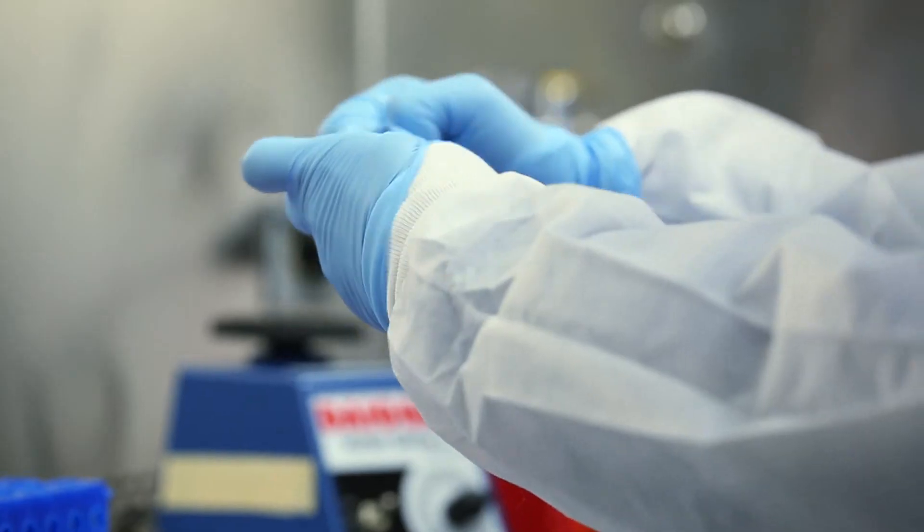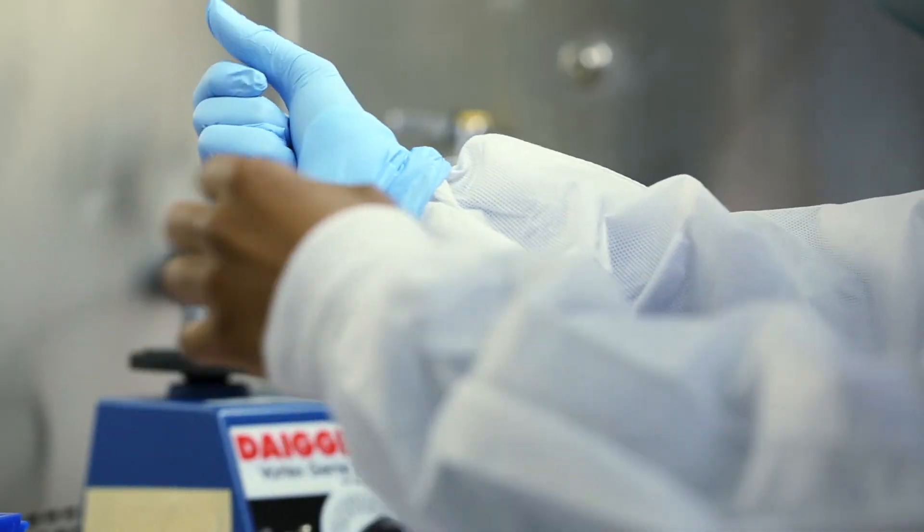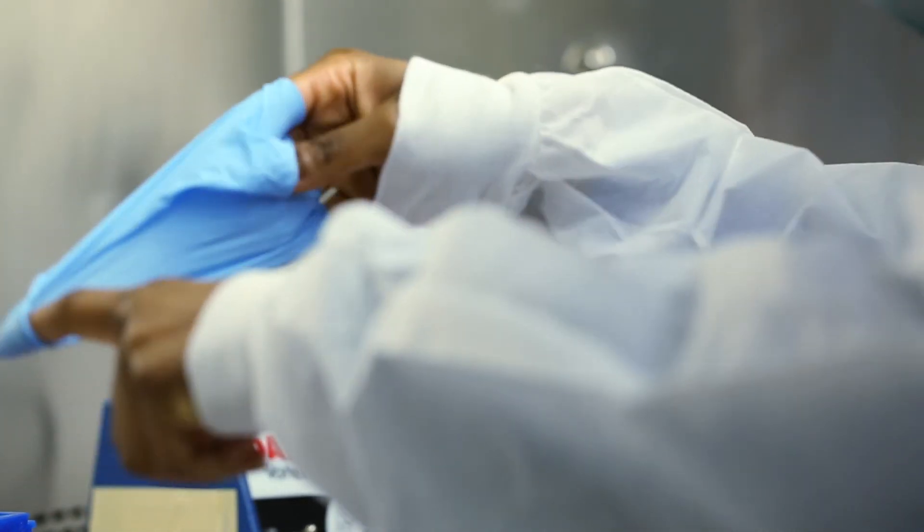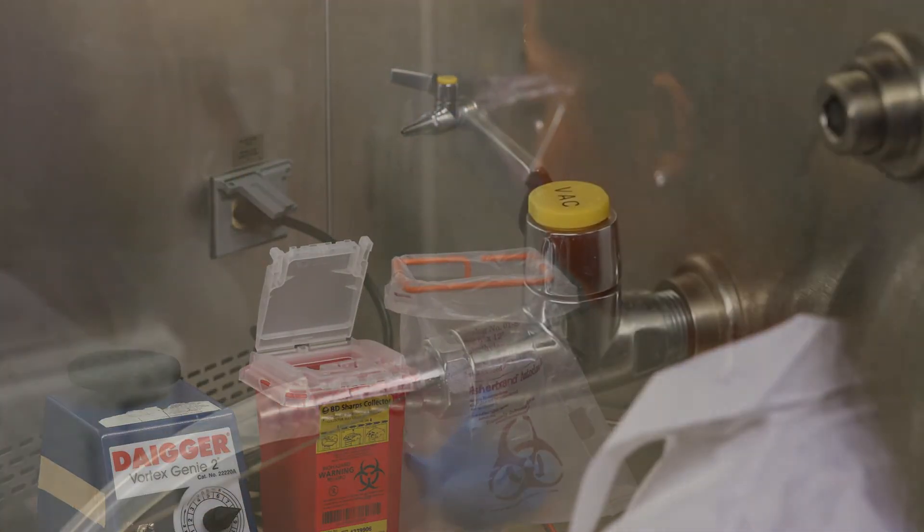Please note, some laboratory SOPs may require you to remove your contaminated gloves and place them in the biohazard container prior to exiting the BSC and put on a new pair of gloves before re-entry.